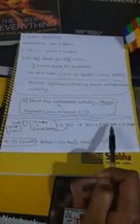That means we will be using 33.25 micromolar of 1500 microliter ascorbic acid. So this 1500 microliter ascorbic acid that we are using here will have concentration of 33.25 micromolar, so that even after diluted, its final concentration comes out to be 25 micromolar that we need.